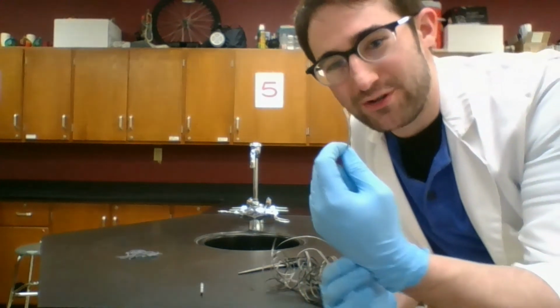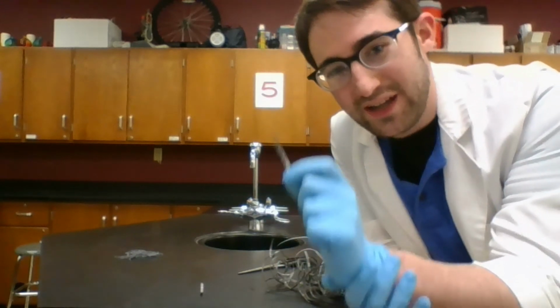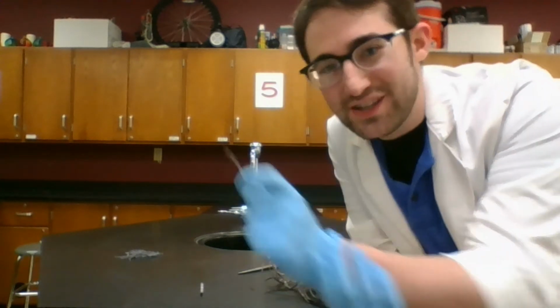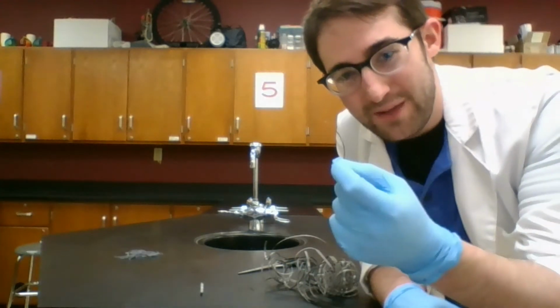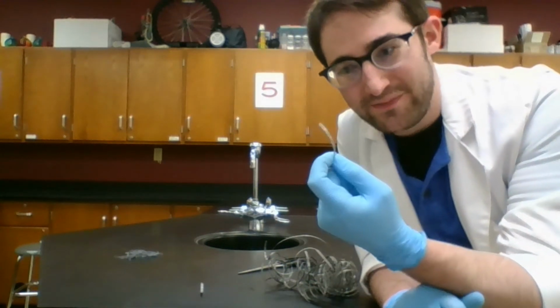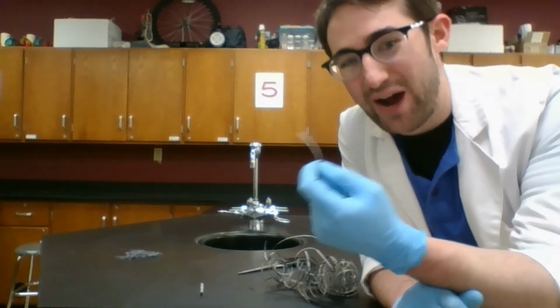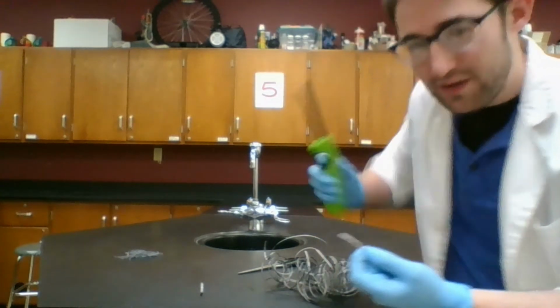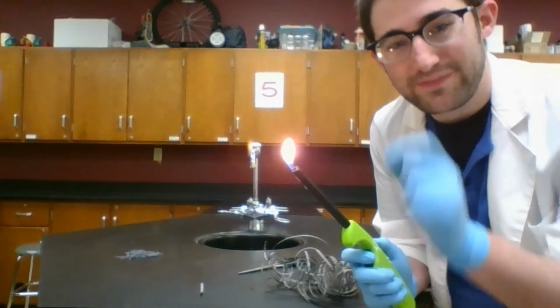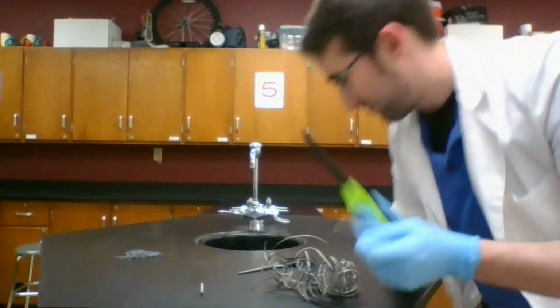Now I can get a chemical change to happen with this, and I actually already have the ingredients with me. Okay, I need the magnesium and the oxygen that's already in the air. I can essentially burn this magnesium by getting it to react with the oxygen in the air. It's taking a little too long just waiting for it to happen as is, so I'm going to speed it up. I'm going to give this a little bit of a kickstart with a lighter. There we go. Okay, so I'm going to turn the lights down and do this in a separate take.